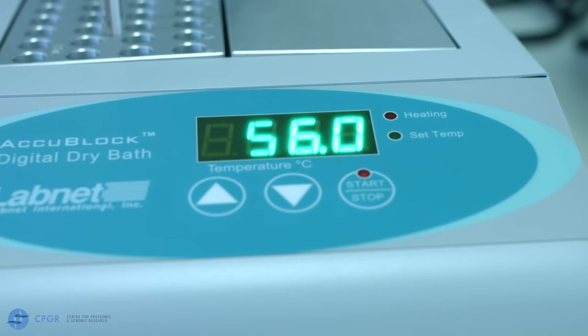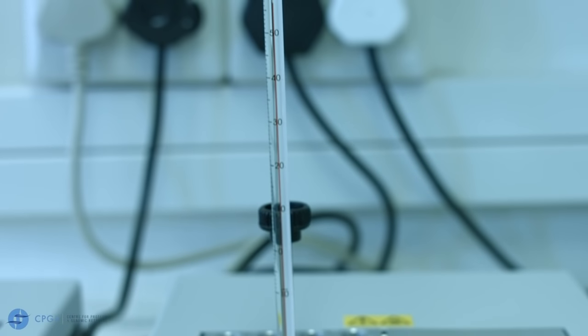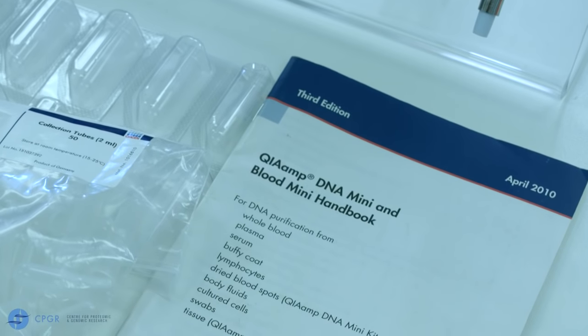Your heating block must have been set at 56 degrees centigrade and ready to use. Before commencing with DNA extraction, please ensure to familiarize yourself with the protocol.